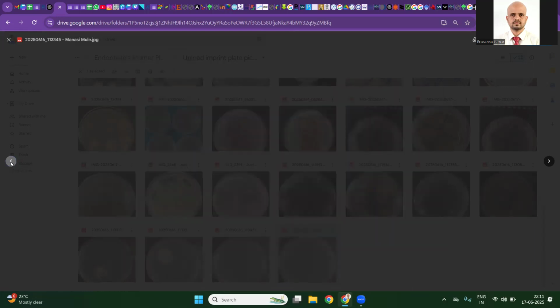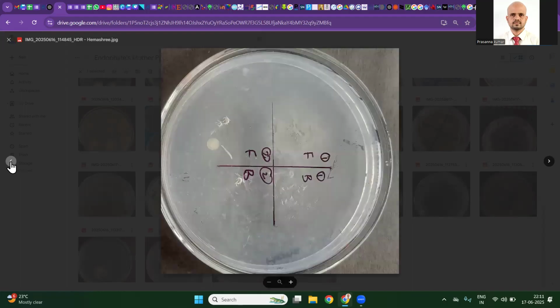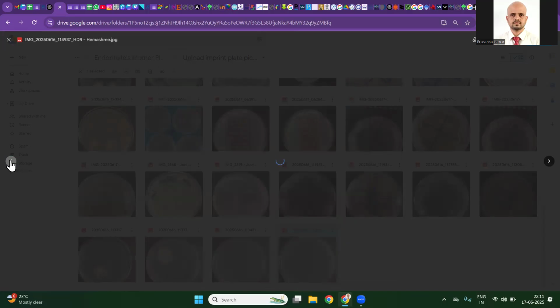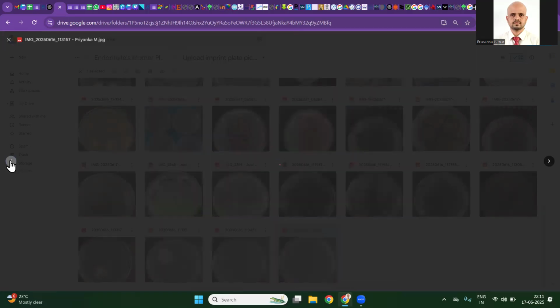See, that's why you should remove the wrapper, but the imprint looks clean. That's good. The imprint has a growth. Okay, I guess we should correct this: it's not maltose, it's a malt extract agar. All right, so again, the imprint has a growth in all four quadrants. Yes, the imprint has a growth.